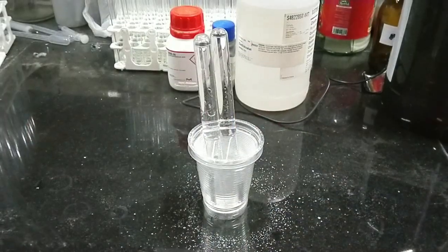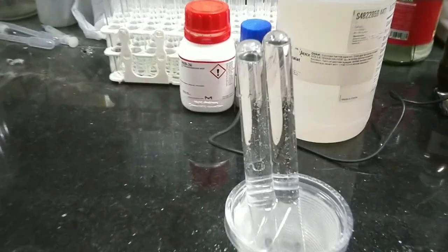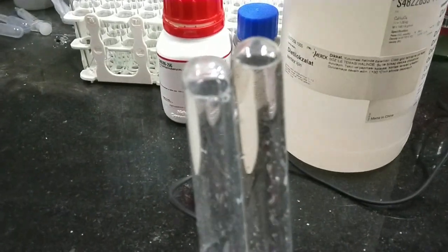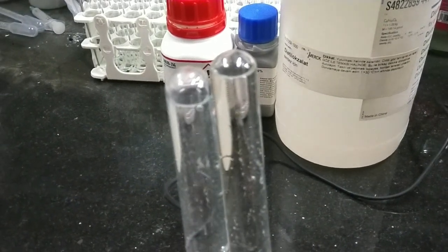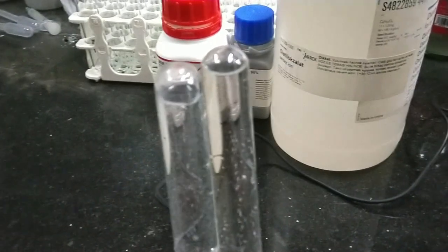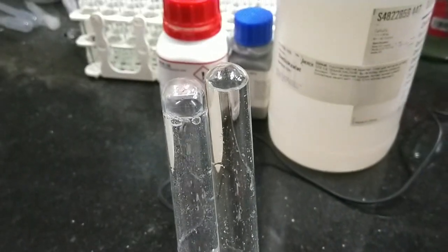I added another test tube to collect the hydrogen gas. You see here the production of gases. The left one is hydrogen that's higher in amount in comparison to the chlorine.